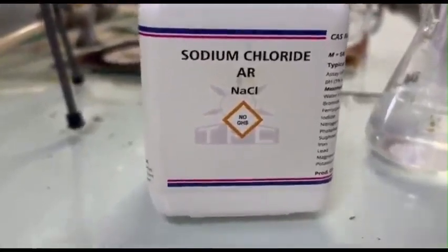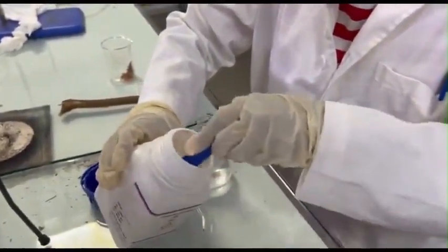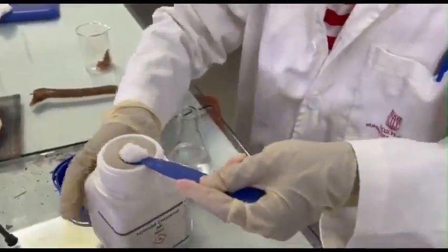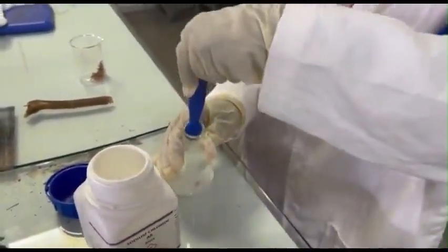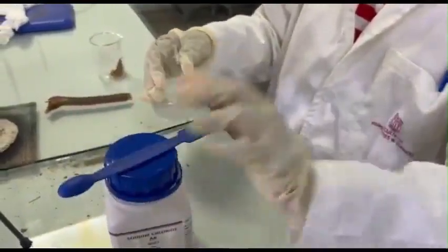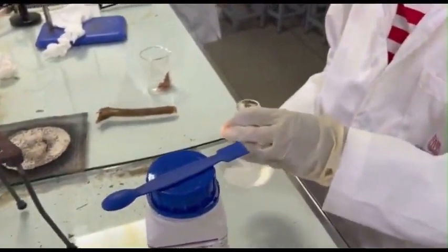At this point, we have a mixture of water and oil in this flask. To facilitate the separation of oil and water, we add 1 scoop of sodium chloride to the collected distillate. Sodium chloride helps to salt out the oil, making it easier to separate the organic phase from the aqueous phase.